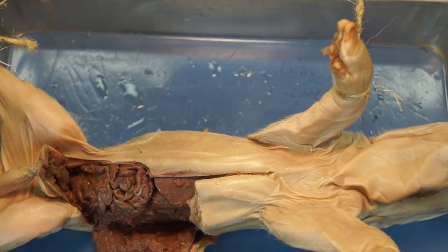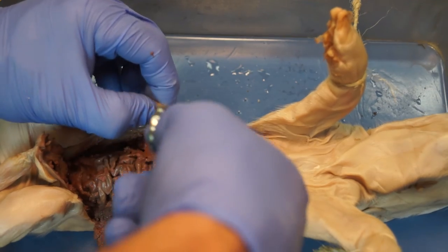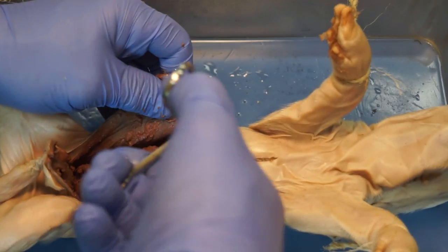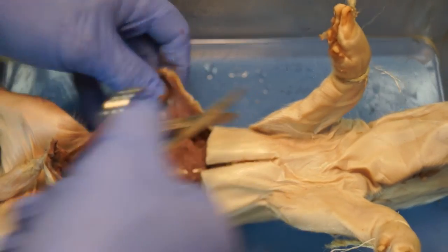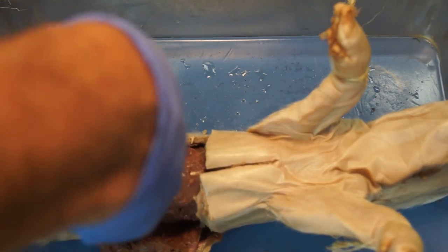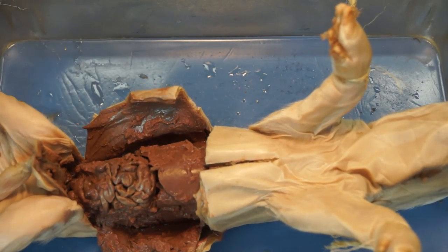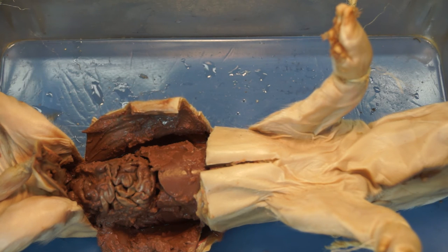You can do the same on the other side. Be careful with the tip of your scissors so you don't cut into any internal organs — keep them just under the skin, under the muscle tissue. Do the same down here. We'll have two flaps and we'll have accessed the abdominal cavity so we can take a look at the digestive system.